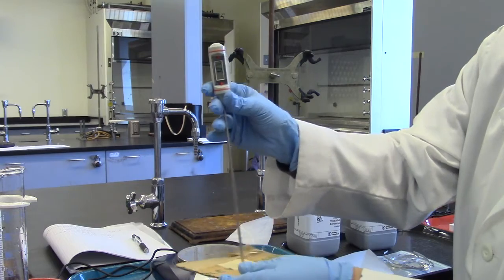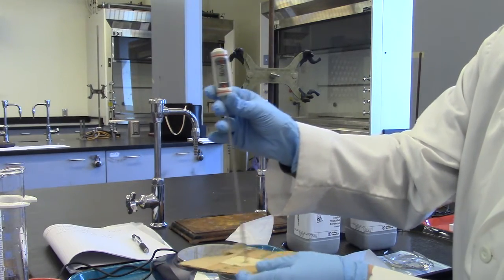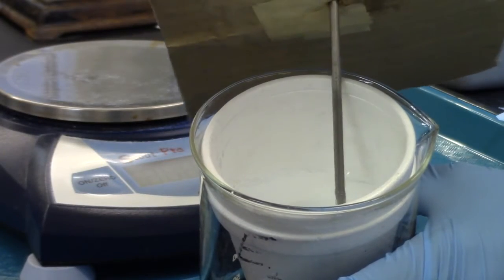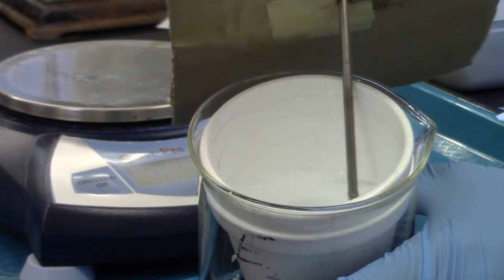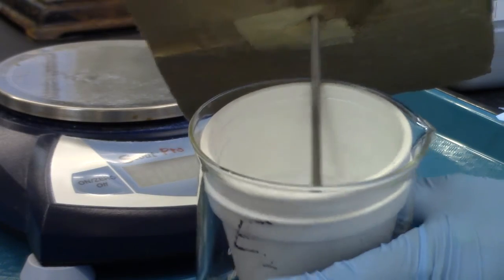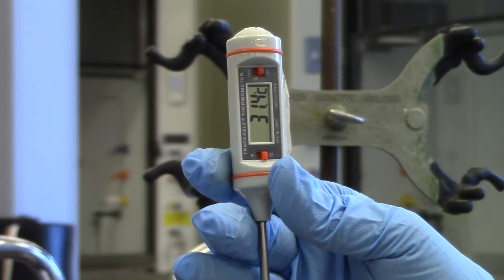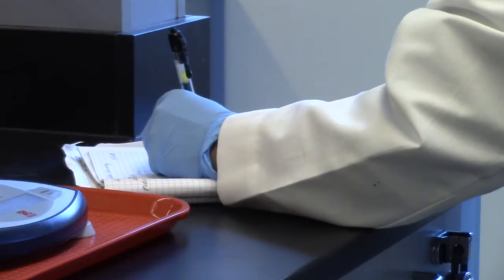Before taking the final temperature reading, make sure all the magnesium strip has reacted. The reaction is complete when the magnesium strip is gone. Take final temperature reading and record.